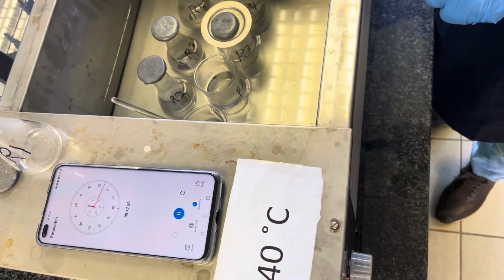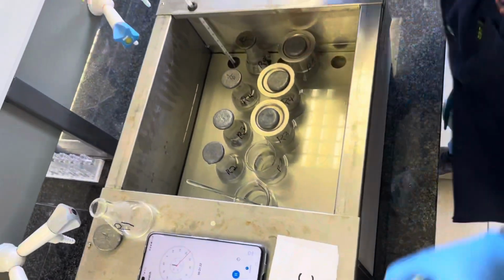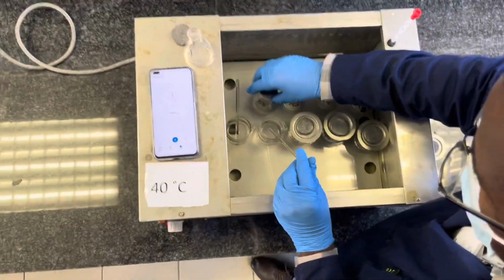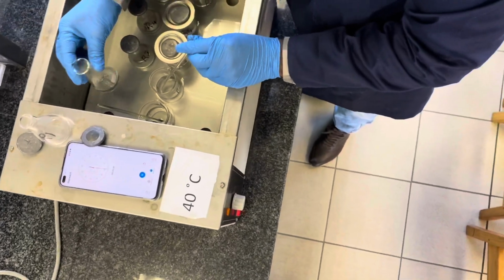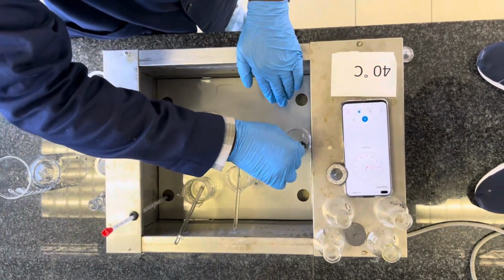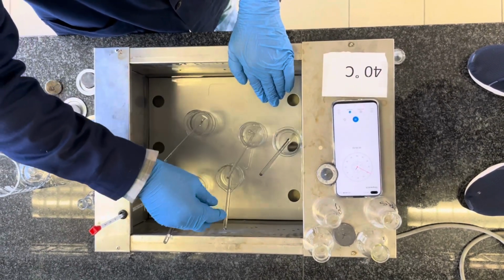Thereafter, you will note down the times when the color change for your reaction mixture takes place, when you start seeing your first blue-purple color change. Continually keep on stirring your mixtures once you've added the potassium persulfate solution.